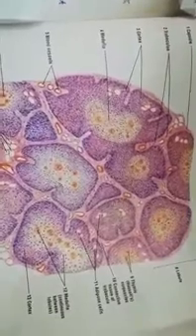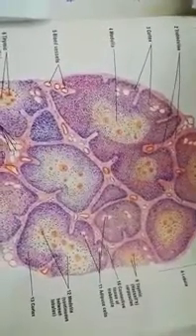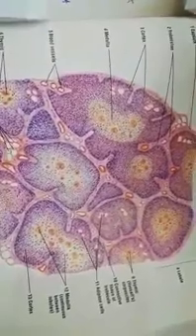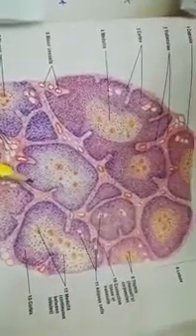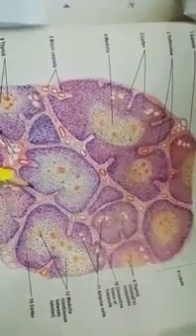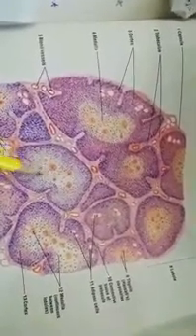Now, how will we categorize these epithelio-reticular cells? They are given Roman numerals. Epithelio-reticular cells numbers I, II, III occupy the cortex of the thymus, and epithelio-reticular cells numbered IV, V and VI occupy the medullary region.